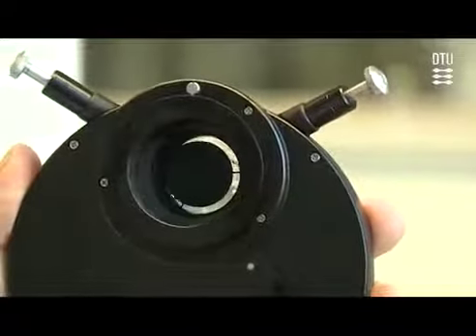So I'll try to show you here with a little gimmick I made. If we take some paper, we can try to see what the condenser does with the light without doing actual microscopy. If we now lower or raise the condenser, you can see the light start focusing, because this cone of light we can make smaller and smaller and smaller. And this is actually almost like it would be if it's correctly set, and you can see the aperture clearly down in your ocular.